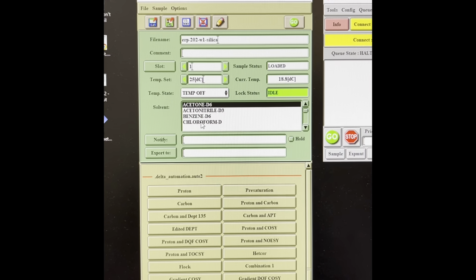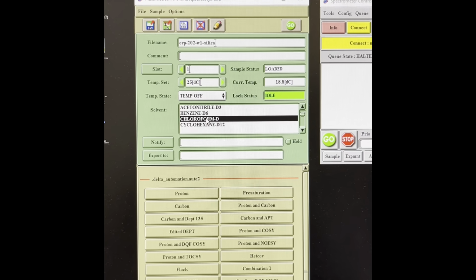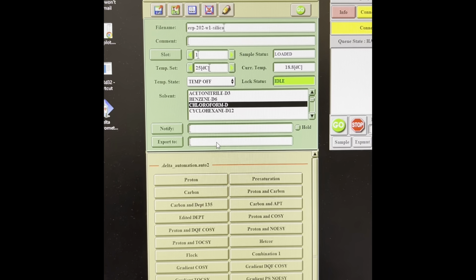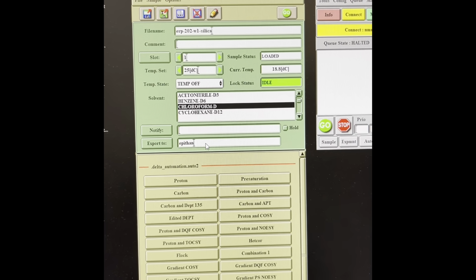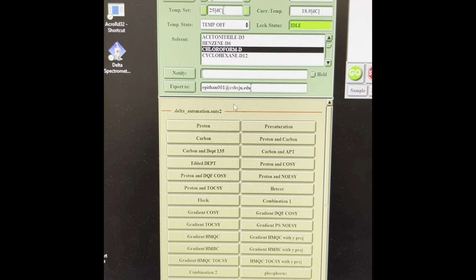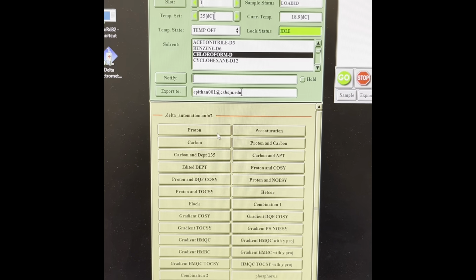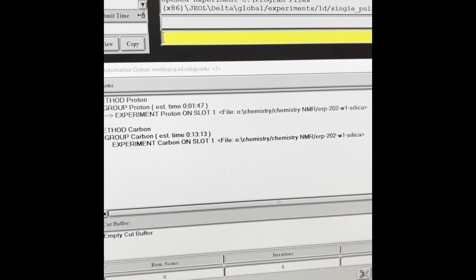You should also double check the solvent area on the page. Make sure that you have the correct solvent selected for your lab project. The last thing you should do before submitting what tests you want is fill in your school email so you can have the tests exported to you when you're ready. Now, you want to go ahead and select whatever tests you want to run for this sample. Proton and carbon will be the main ones you use in 201, and they are the first options on the page. If you're ever unsure what projects you want to do, go ahead and refer to the sheet on the wall of 203.